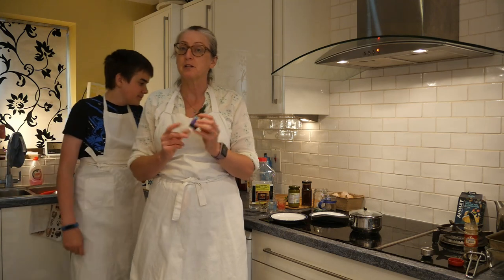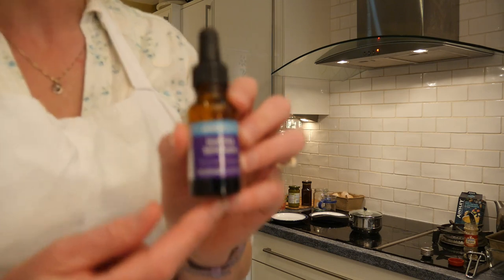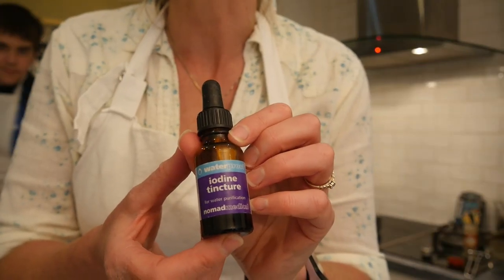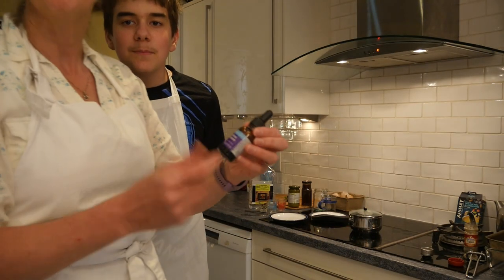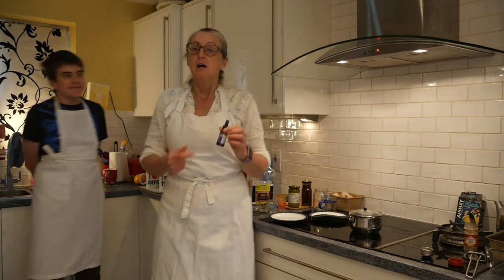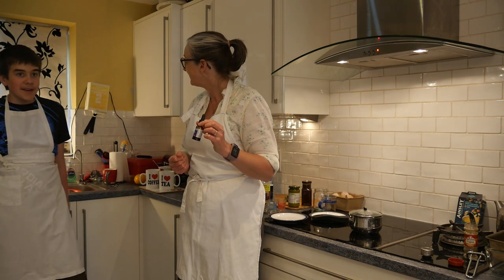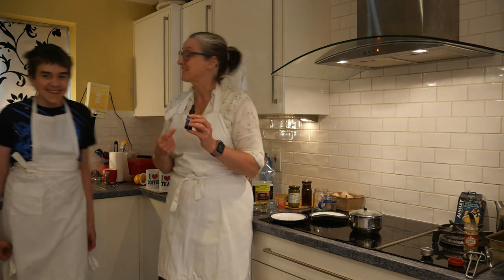So if we tell you the chemical that you need to order, you can get it in place already. This is tincture of iodine, as you can see from what it says on the label. We've got this one from a place called Nomad. Nomad do outdoor supplies for people who go hiking and camping. And why do we need it from a hiking and camping store? In case you get a cut — it acts as a disinfectant.